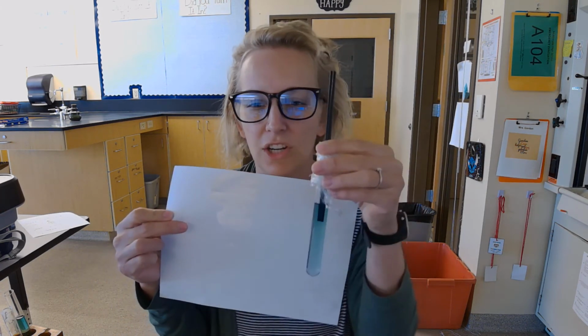I'm going to go ahead and do some vigorous exercise. I'm going to do that for 2 minutes. Then I'm going to return here and we'll run our final test. I'm back. Look at my hair. You know I worked for 2 minutes. Time how long it takes for the solution to go from blue to yellow.